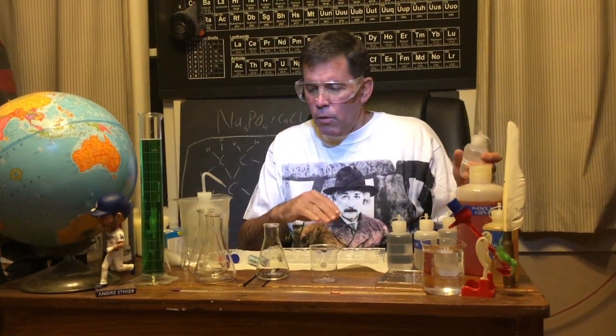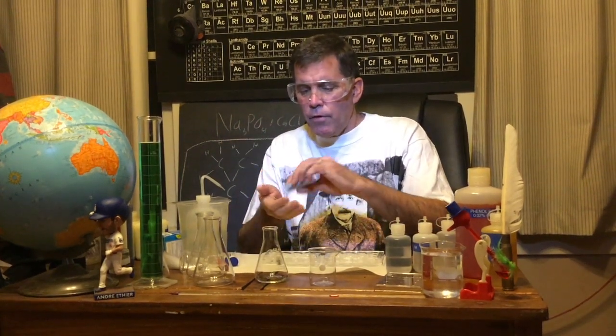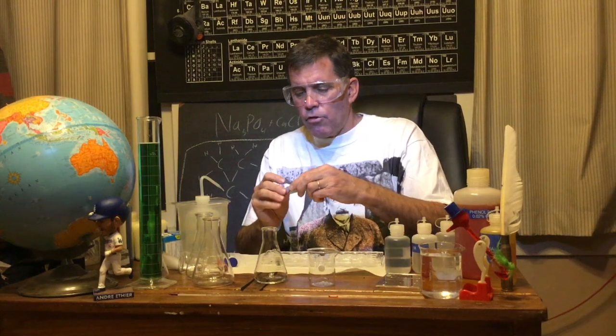So I'm going to test different solutions, acids and bases, and we're going to test it with these cool chemicals called acid-base indicators. Acid-base indicators are actually dyes. So a dye, something like this, a colored solution, and you can put it on paper, and something really fun happens is that that paper can change color depending on if it's an acid or base that hits it.